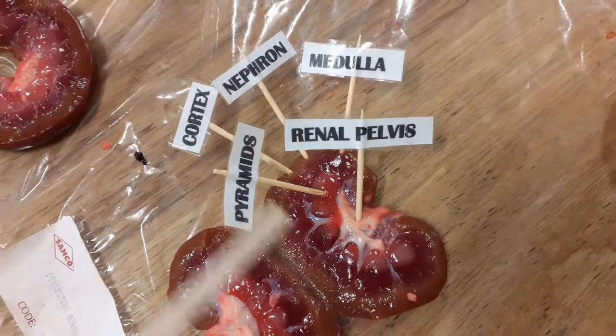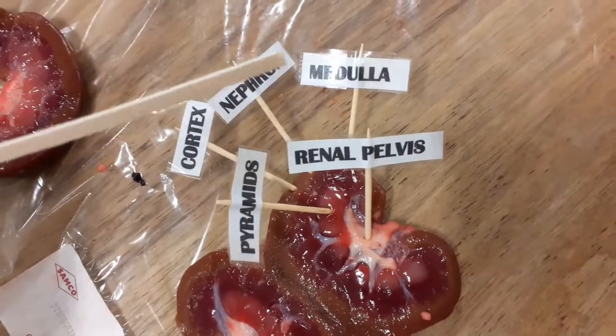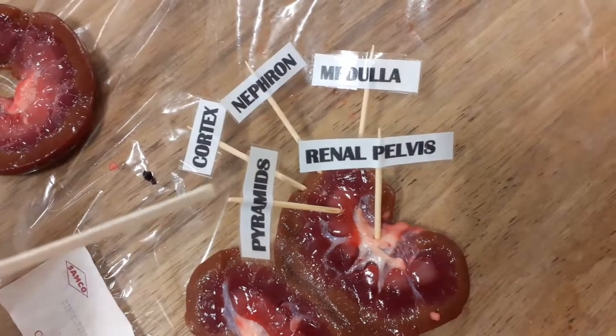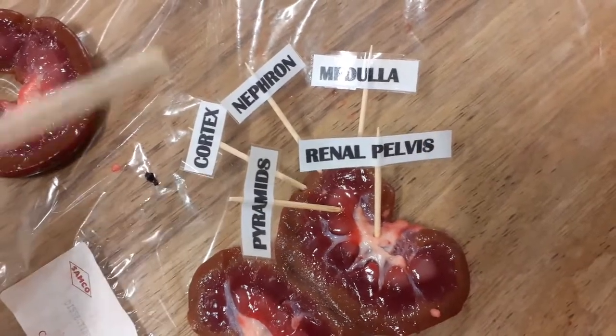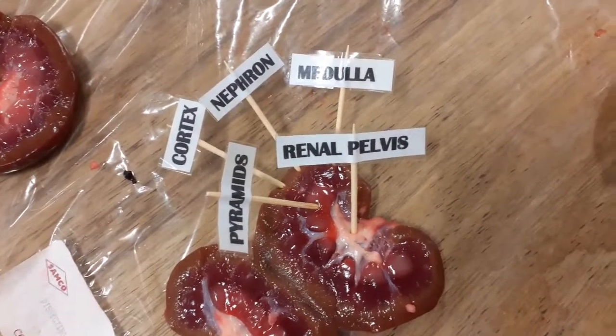Again, the nephron is in the cortex. The medulla is rich in blood. We have the pelvis. That's part of our urinary system, and the pyramids that contain the loop of Henle.